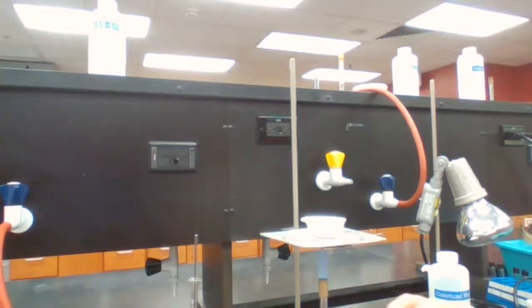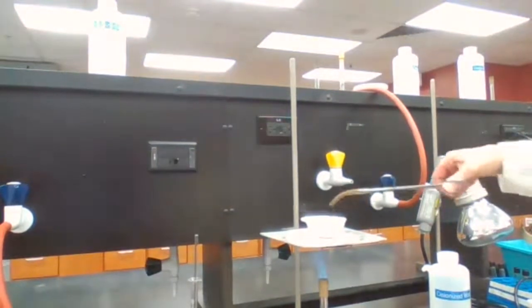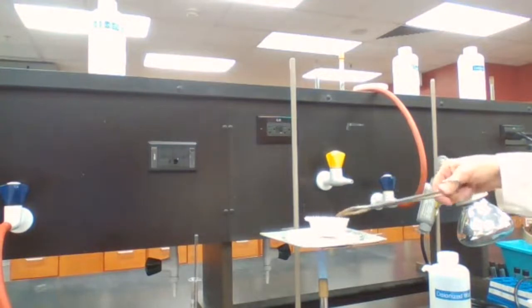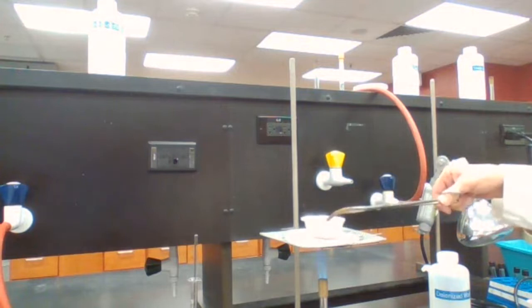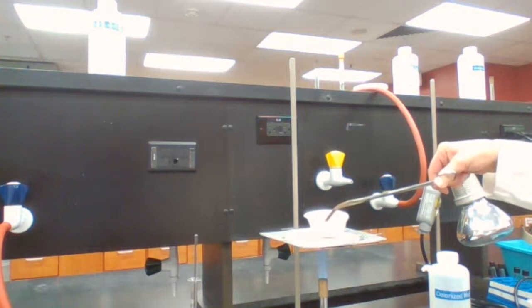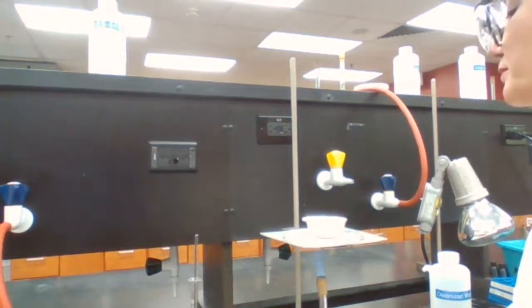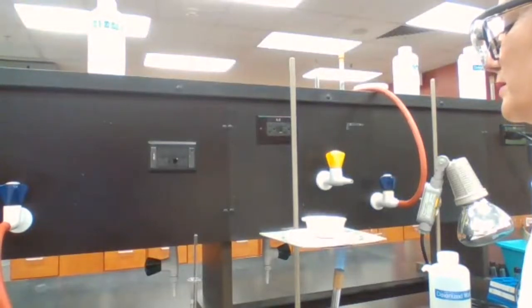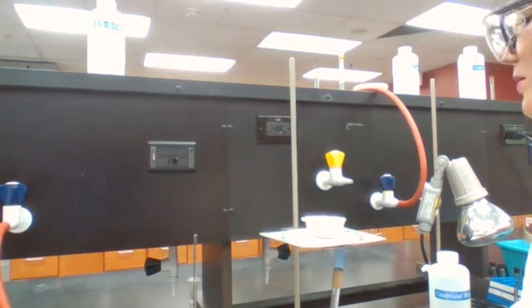But now, 2 minutes, right? So, estimated. It's just such a small volume. The problem could be that the concentration is very high. Almost there, almost.